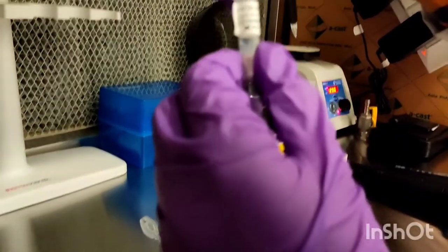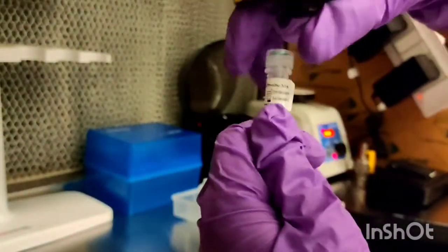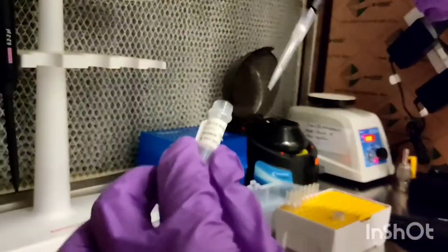This is the primer and probe. We'll take 60 microliters of primer and probe.